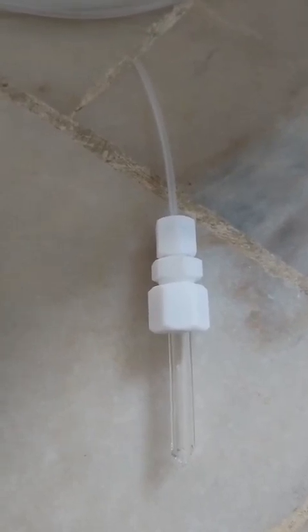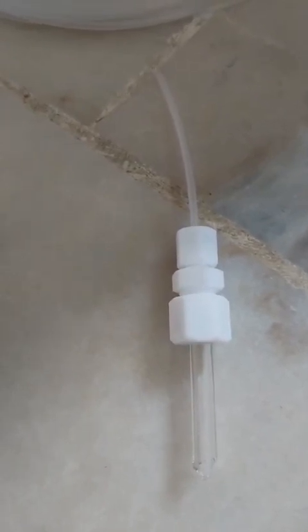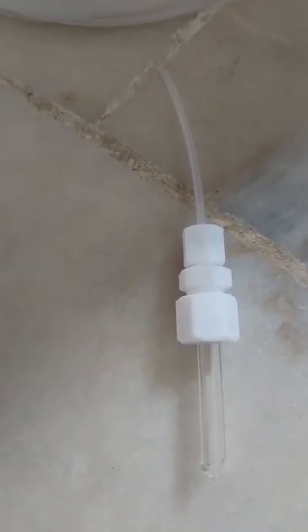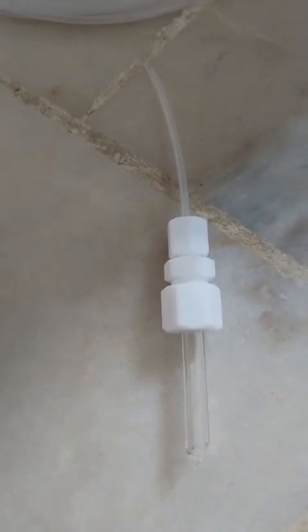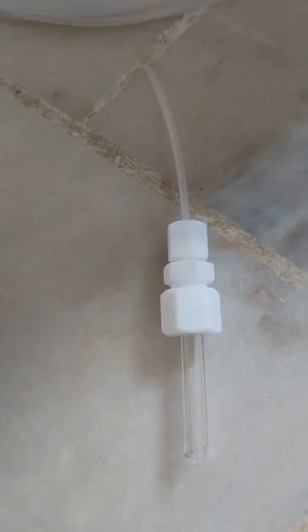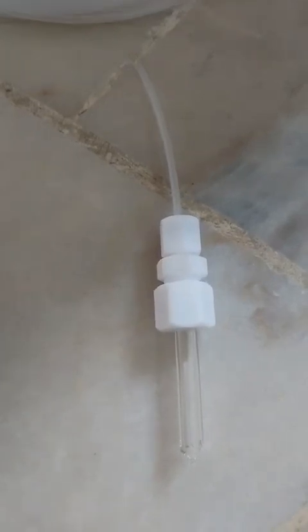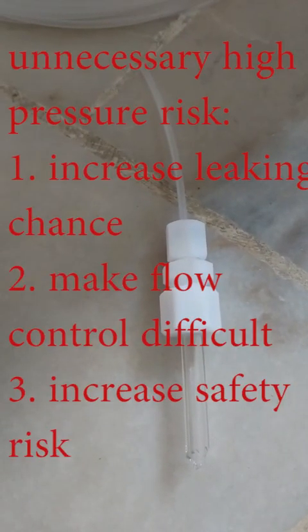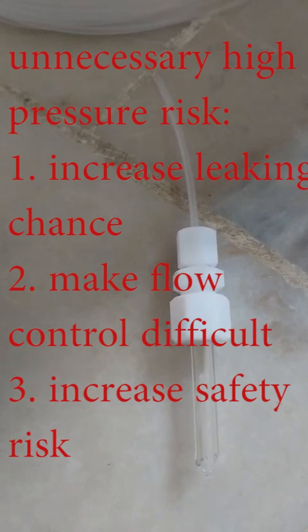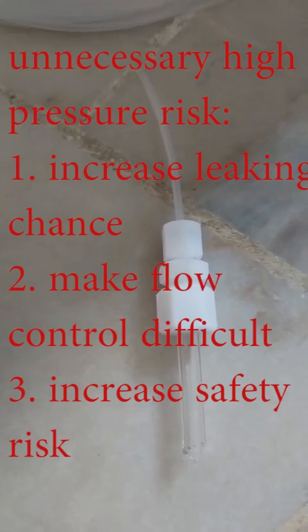In fact, based on my experience, you don't need to provide very high pressure. Normally, you give 0.1 to 0.15 megapascal. It's more than enough to provide enough flow rate, even for a total of 8 flow lines when you are using them. Because the higher pressure that you provide cannot help anything. That only makes your control more difficult. Pressure in the whole system is only atmosphere, so you don't need to overcome high pressure to reach the flow rate that you need.